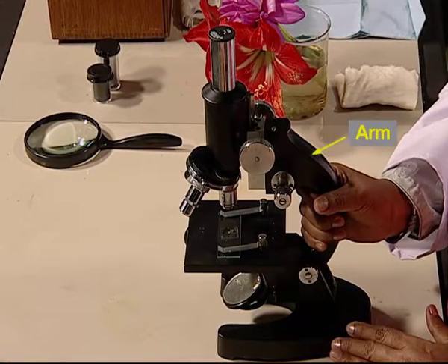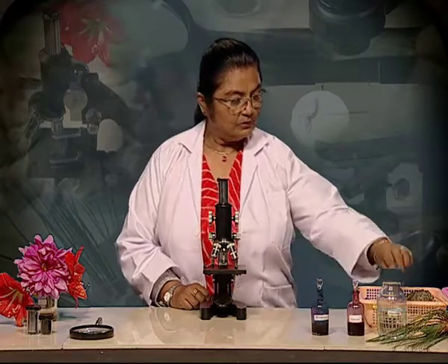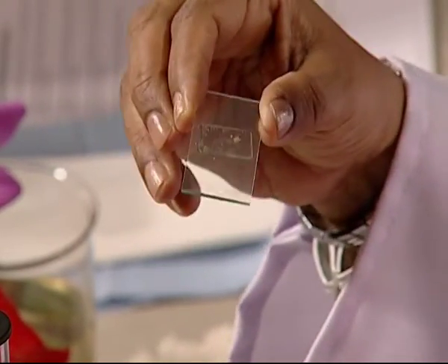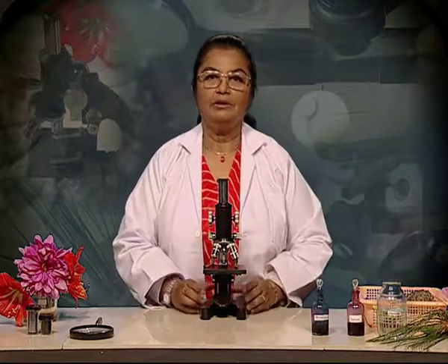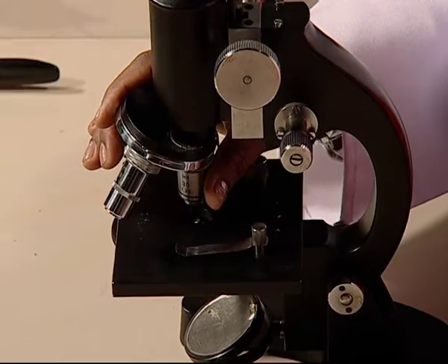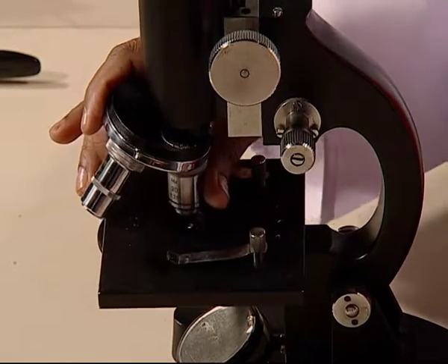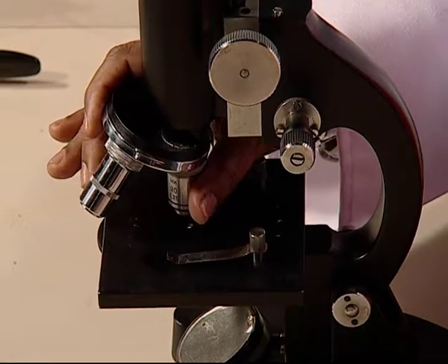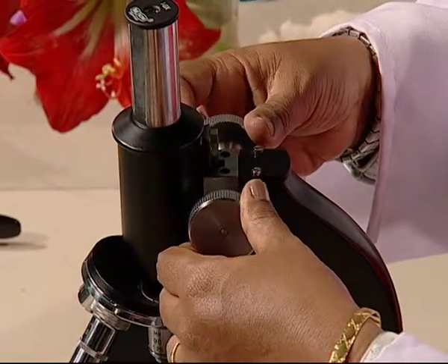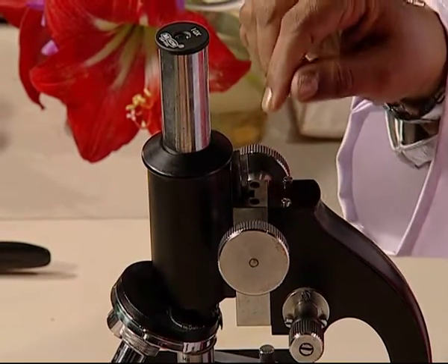Also, the arm of the microscope. Let us see how to use a compound light microscope correctly. We will see the same slide of the yellow powder of dust that we had taken from the male cone of pine. First and foremost, lock the low power lens in place. If you remember, 10x is the low power lens. When we rotate the disc, we should hear a click sound while locking the lens in place. After that, raise the low power lens away from the stage. This lens should be facing right above the hole on the stage.